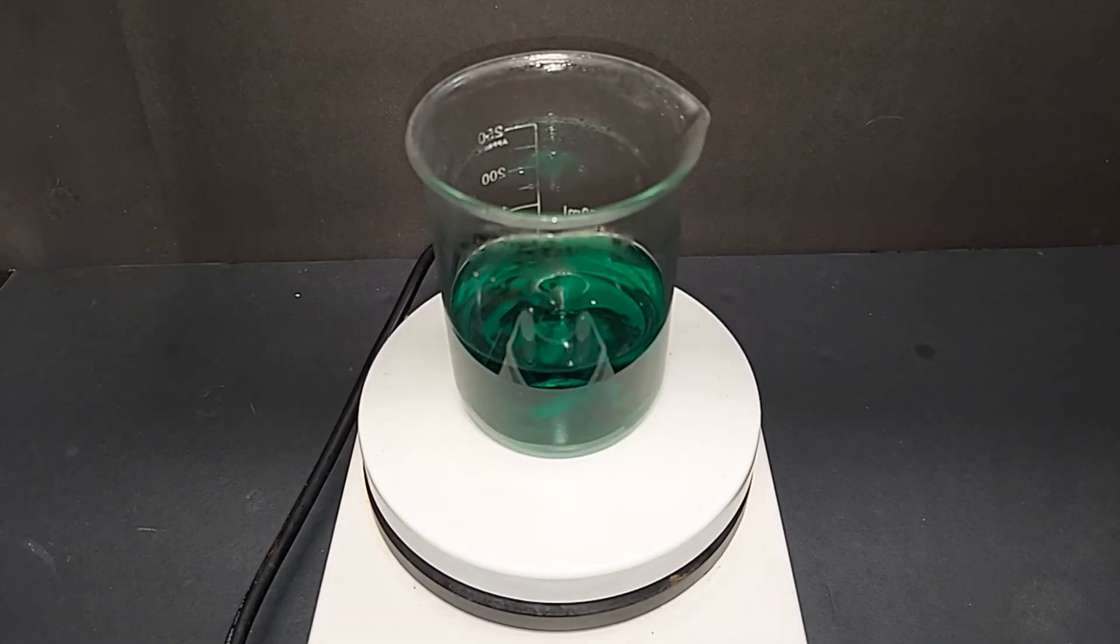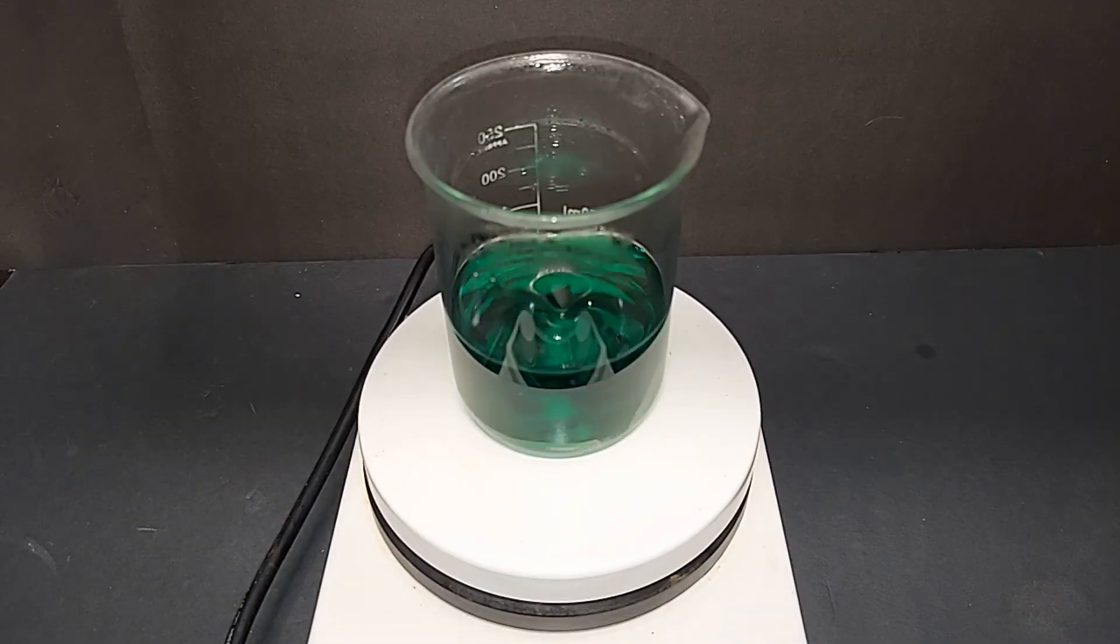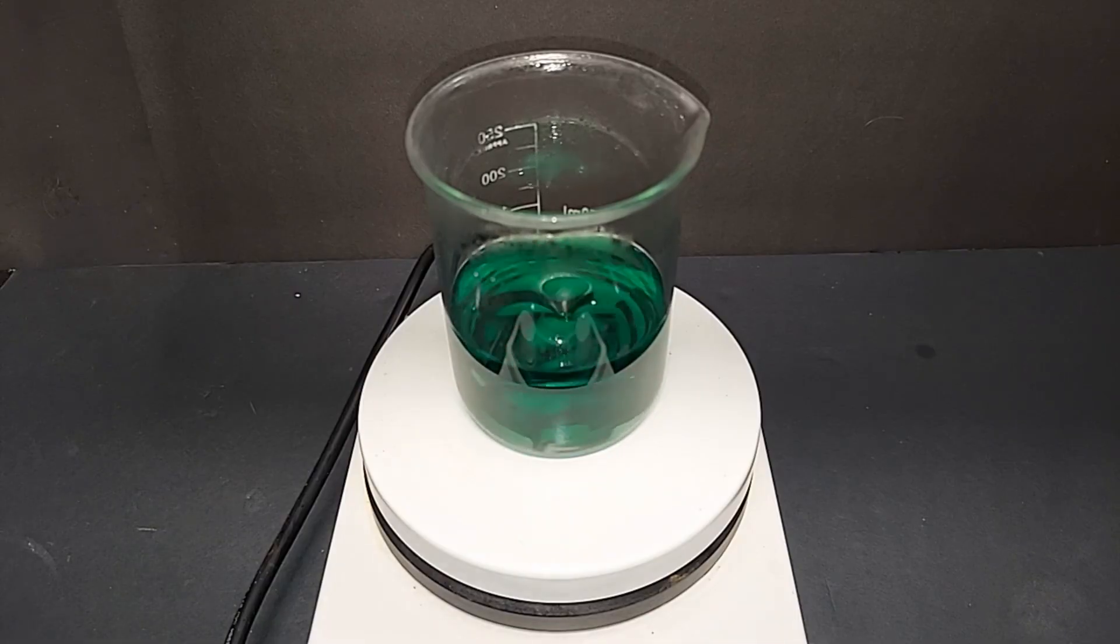I reached a temperature of about 80 degrees Celsius and it's been running for about a half hour with this mixing. A little bit more dissolved, but it doesn't look like it's still going to quite do it. So we're back to the 30% hydrogen peroxide. I am going to keep it mixing, turn it down just a little bit here though so we don't form so many bubbles that it overflows, which almost happened one time.